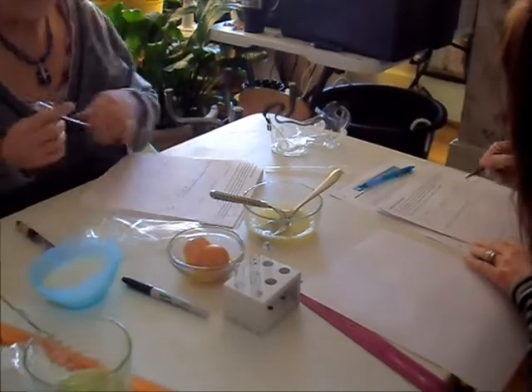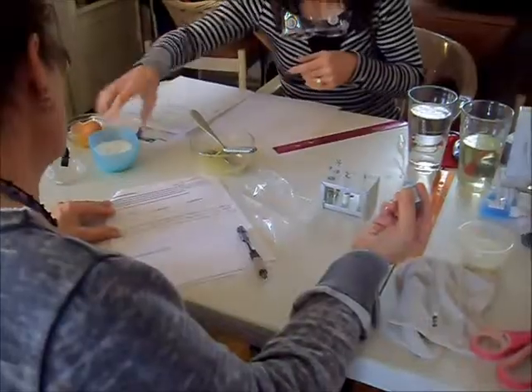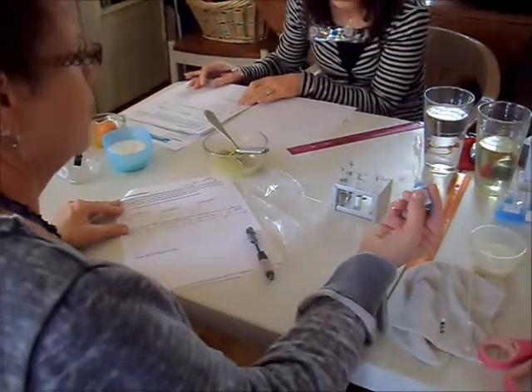Two centimeters mark with the protein solution. One drop at a time until we see a color change.